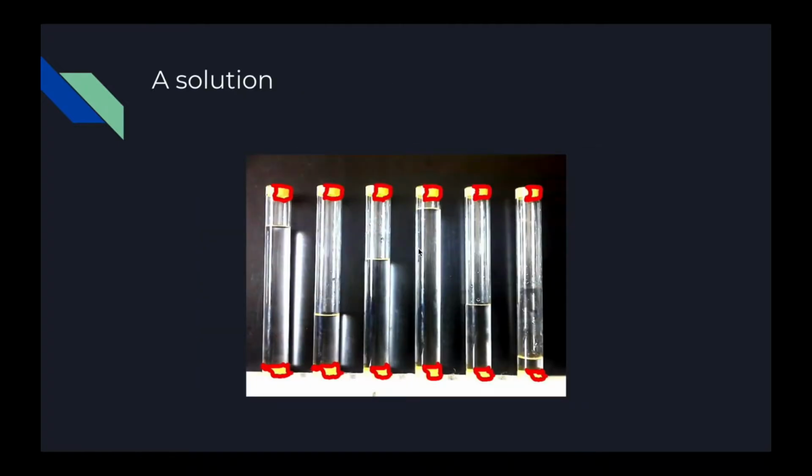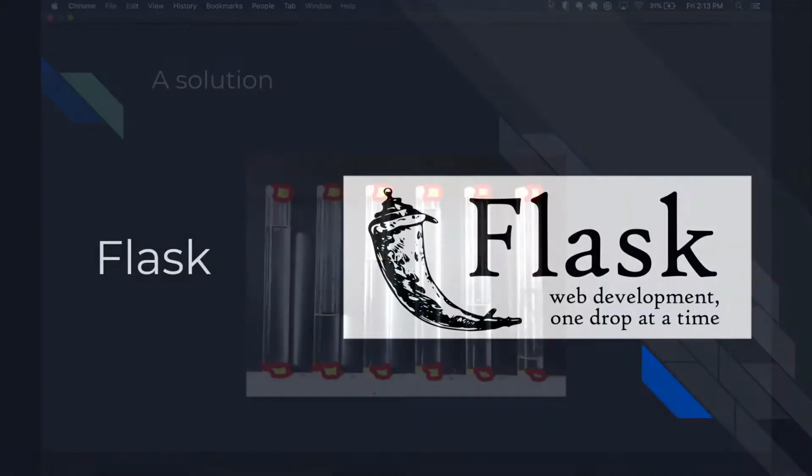In came markers. You can see the yellow markers on top and bottom, and when we match two markers vertically, we are able to find out what is the container of the test tube. So given this rectangle here, it is much easier to find the water level than if we did not have the markers. And this is our final solution, and from here we would output a bunch of percentages of how much water is in each test tube.